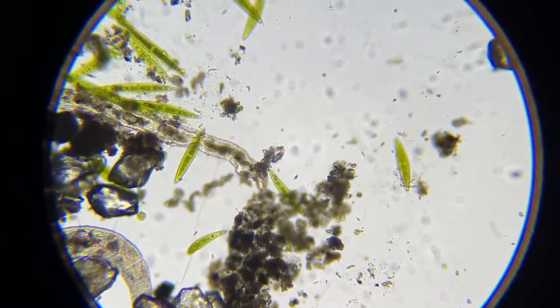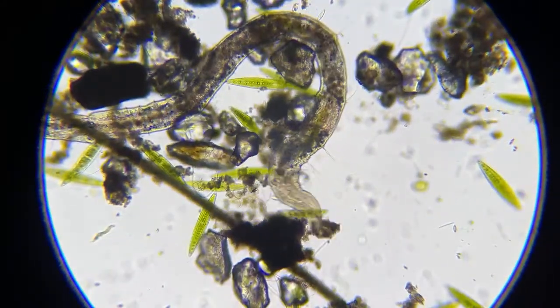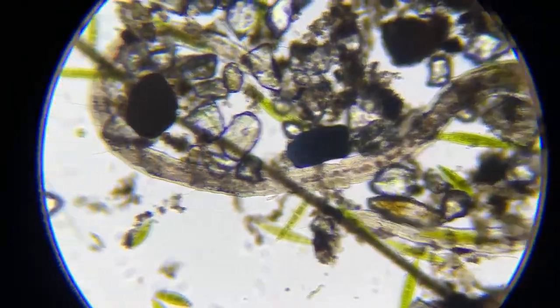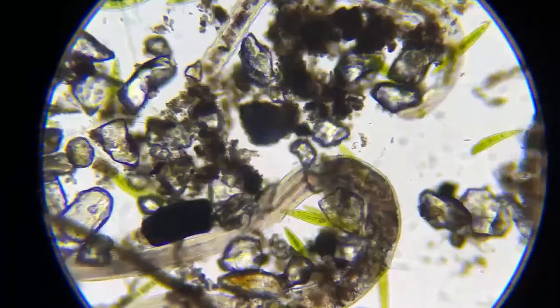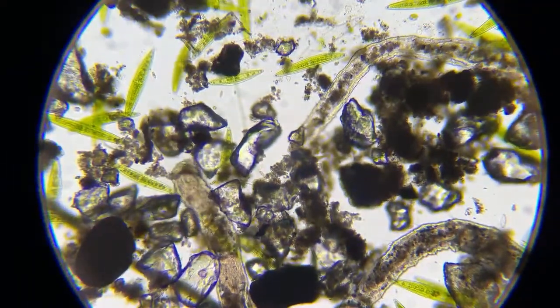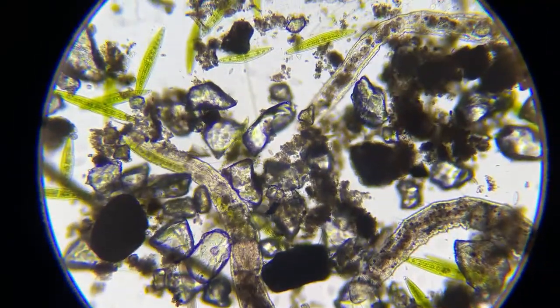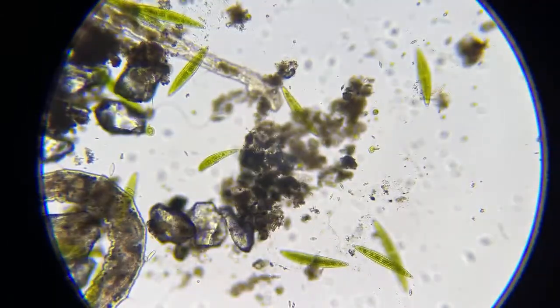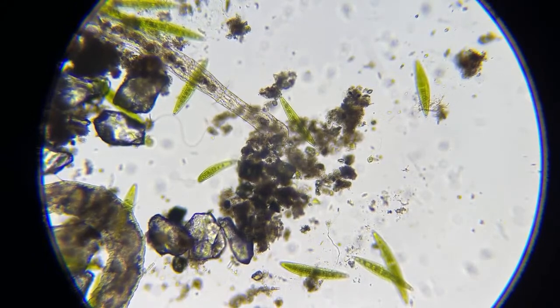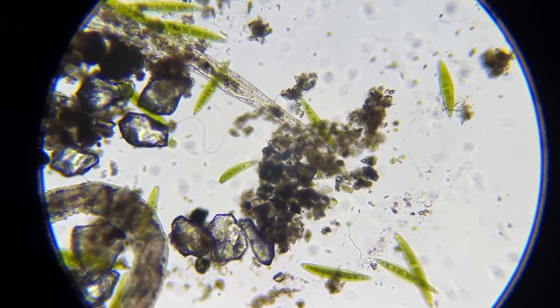This right here, this is an annelid, definitely. He's segmented. You could see a hair or a seta on each segment of him. So these are segmented worms, and even though he looks much grosser, he looks more mean than that hookworm, these guys won't hurt your dogs. They'll drink these like soup. This is the Aeolosoma. He's a segmented worm also, and he won't hurt your dogs. But that little tiny hookworm is a beast.